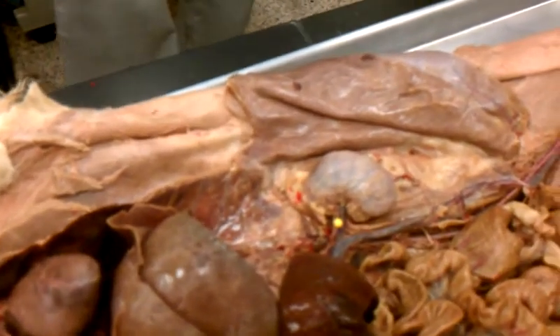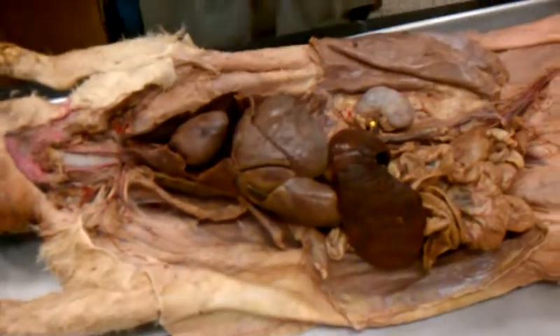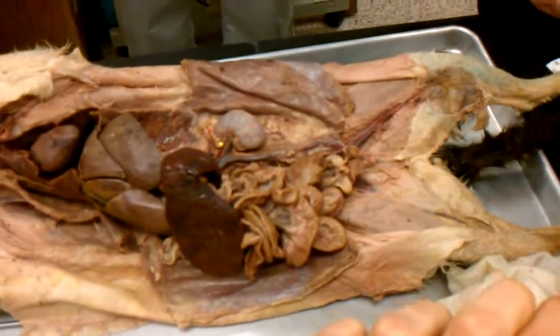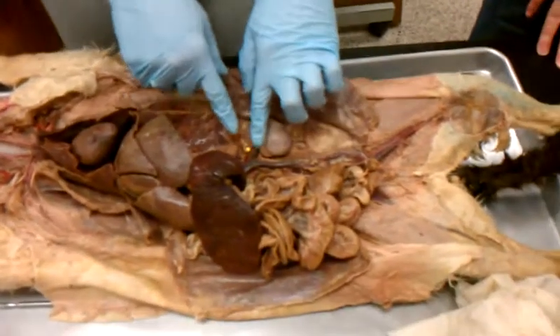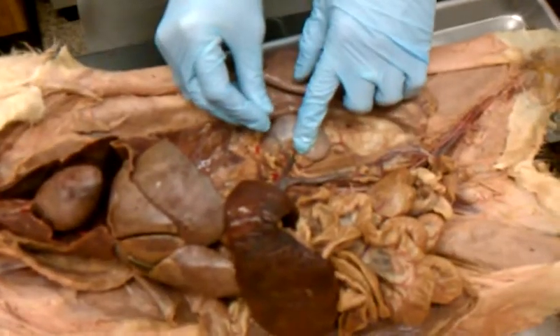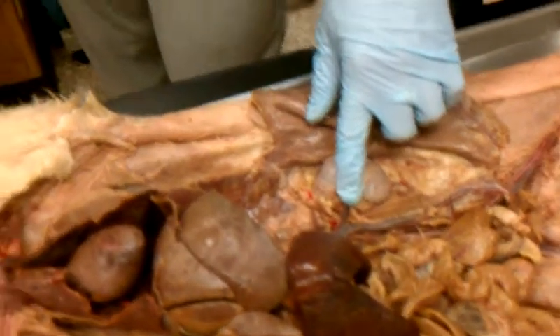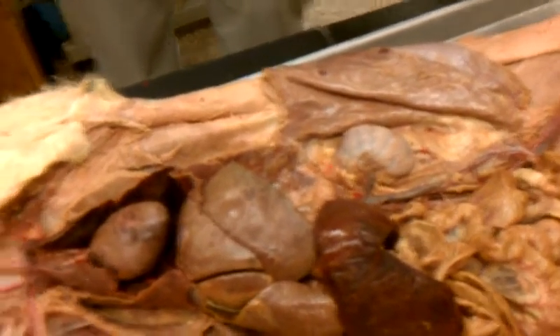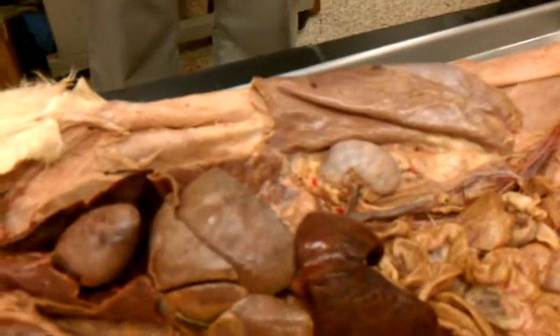Does everyone see that? So for the renal arteries and veins, I went left and right. Those are easy to see. Just like your common carotids and your subclavian, I need right and left. So please put right and left. When in doubt, it's never going to hurt you to put right and left. So this is the right or the left renal artery. Right next to it would be the left renal vein. Like I said, if I ask this to you, I will ask, what is the artery or what is the vein? So please read those questions. If I ask you the artery and you put the vein, you'll probably get half credit if you put renal. But besides that, you won't get full credit.